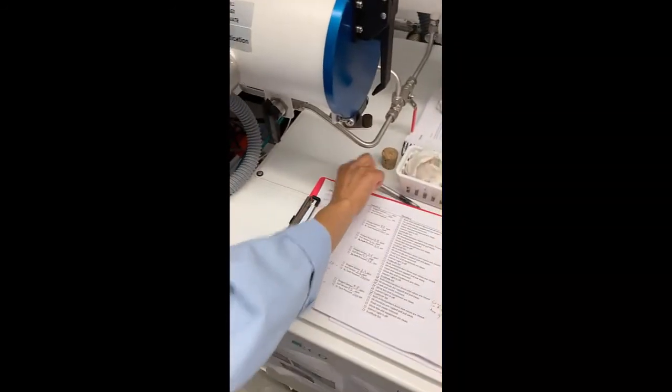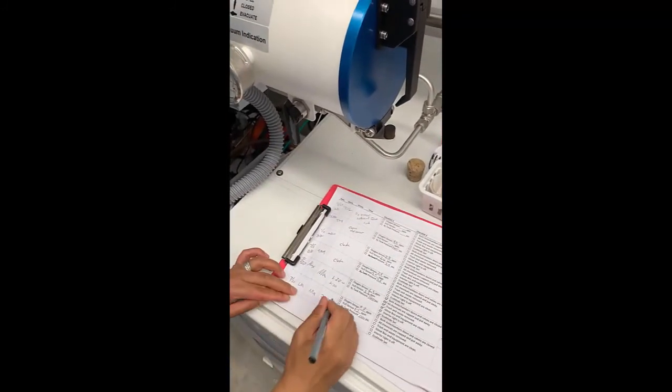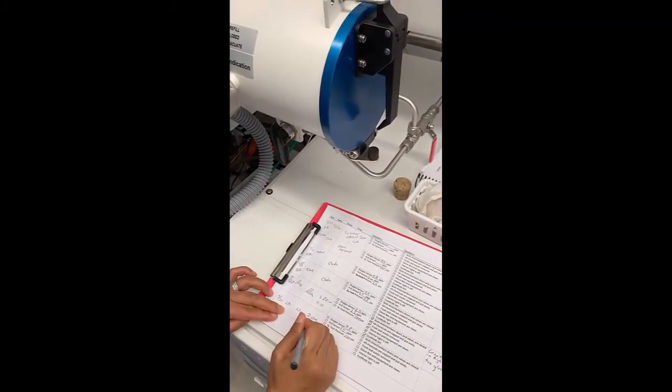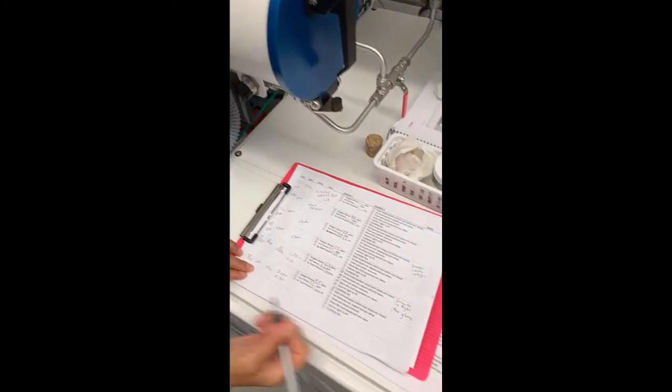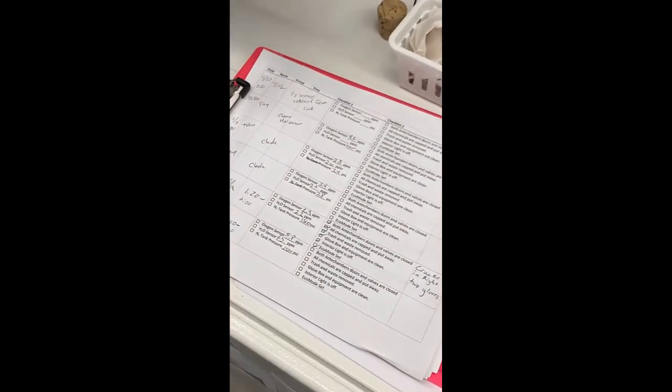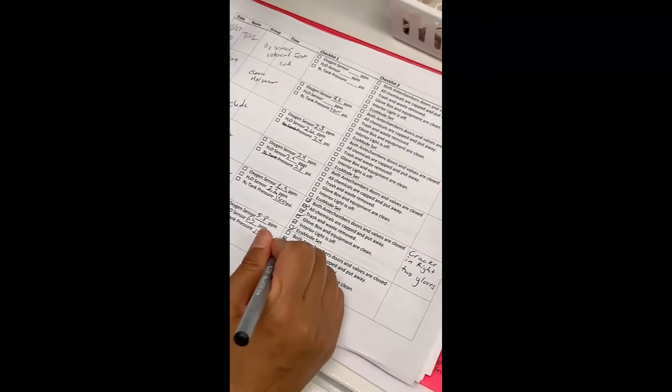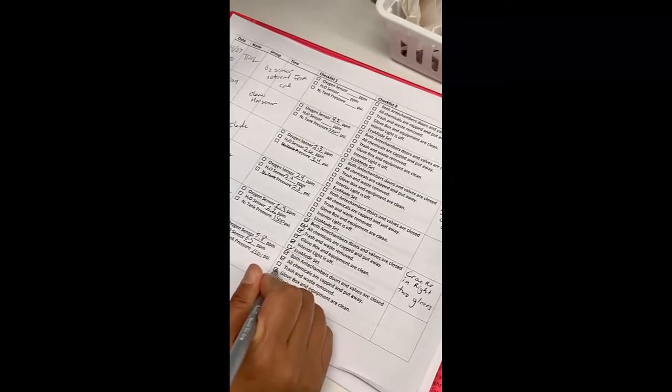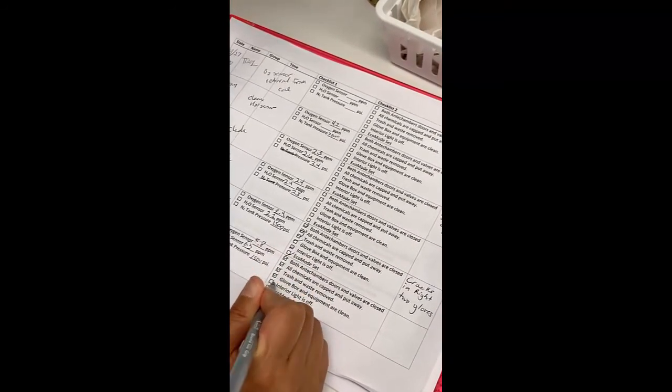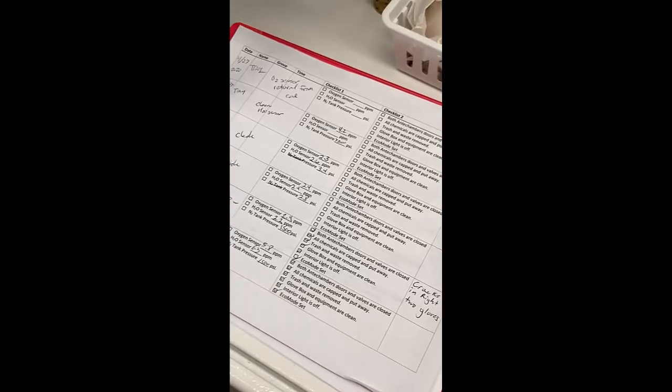Then, make sure to sign out, putting the time that you left the glove box and making sure to go through the final checklist and make sure that everything is checked. And that's it.